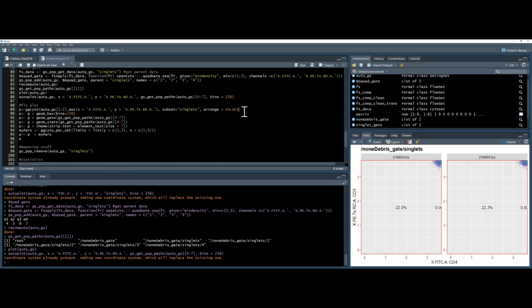So I knew this was coming, so I've already prepared a fix. We're going to be using GG Cyto, and there'll be another video about this, but this is the same way as you produce a plot using the ggplot package. So I'm going to use my files gating set. I don't really need 1 to 2 there, never mind.